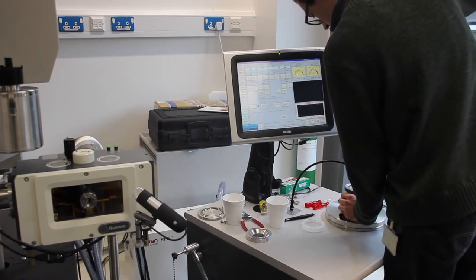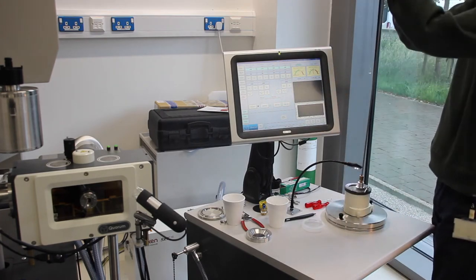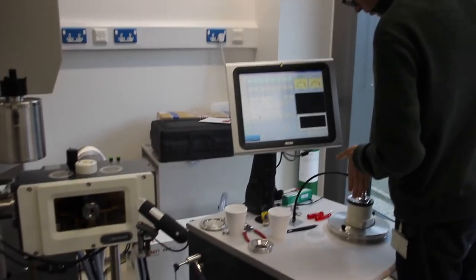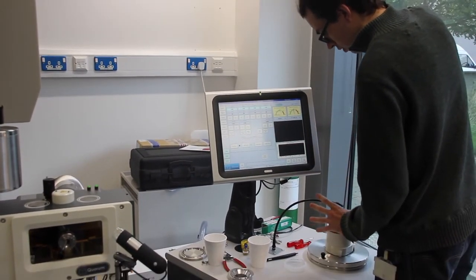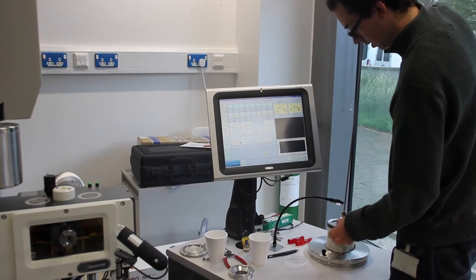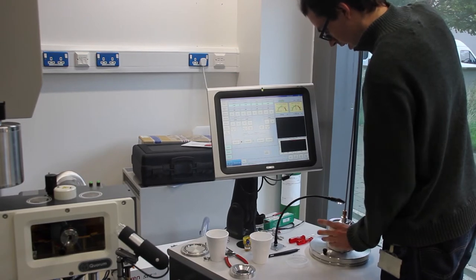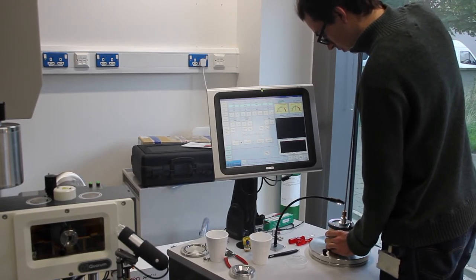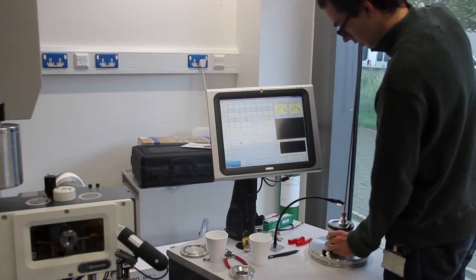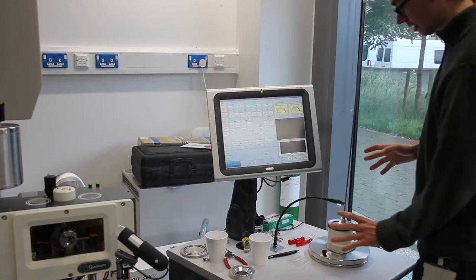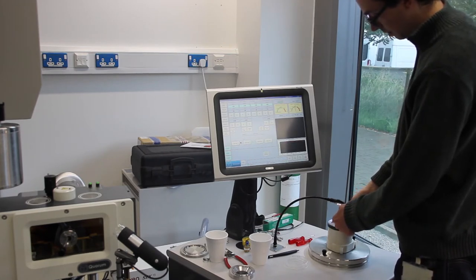Now I'm going to take the rod and insert it into the bottom or the top visible part of the shuttle. This is done where the holes and the swing nut are parallel to the entry holes on the shuttle. Now this locks when it's turned 90 degrees, but if it's turned 90 degrees then the shuttle will not be able to escape from where it's sitting right now in the transfer box. So what we do is we turn it just about 30 degrees, just enough to lock it a little bit. Then we bring it up ever so slightly, while it's still in liquid nitrogen but it's able to clear the sides of the well.